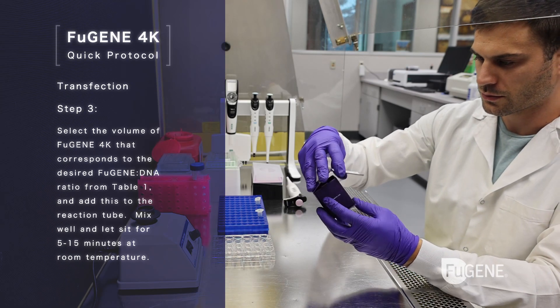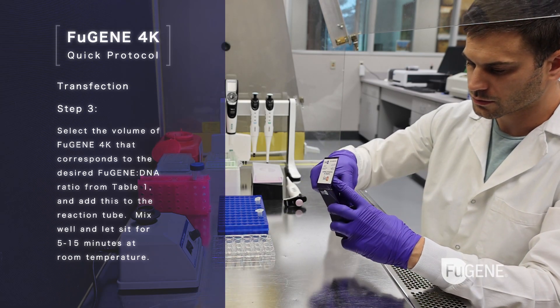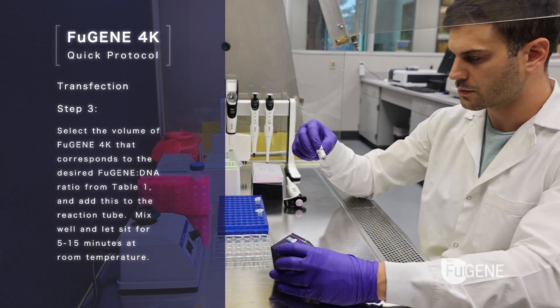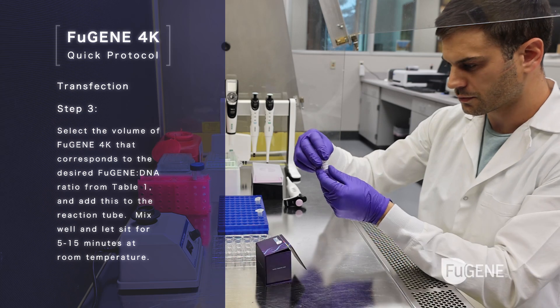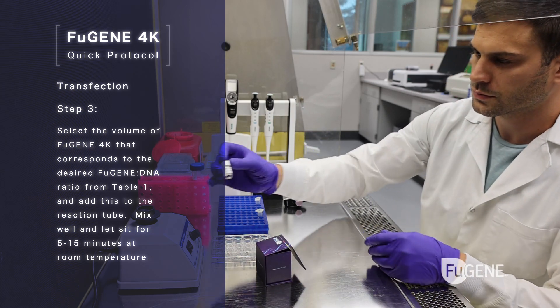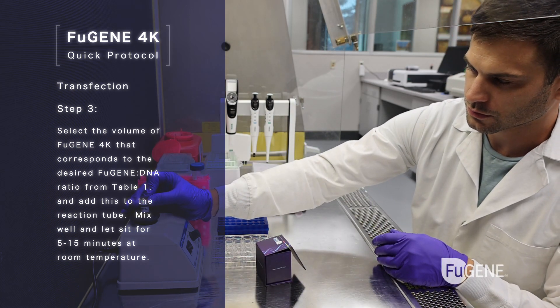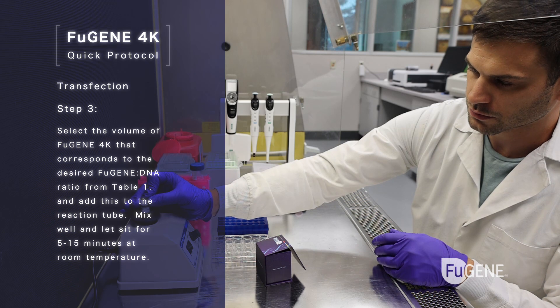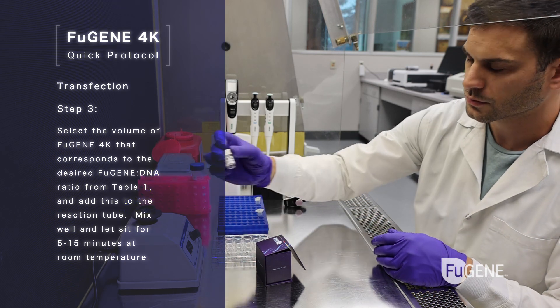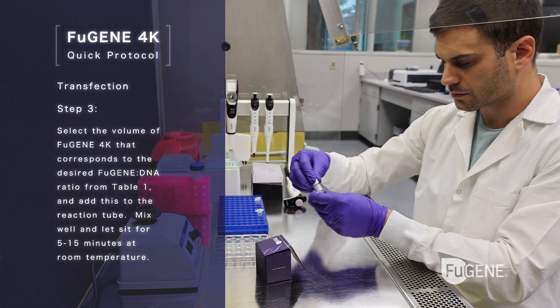Step 3: select the volume of FuGENE 4K that corresponds to the desired FuGENE to DNA ratio from table 1, and add this to the reaction tube. Mix well and let sit for 5 to 15 minutes at room temperature.